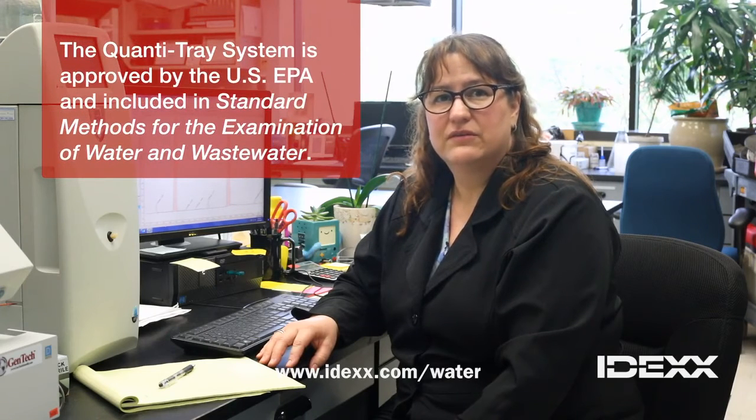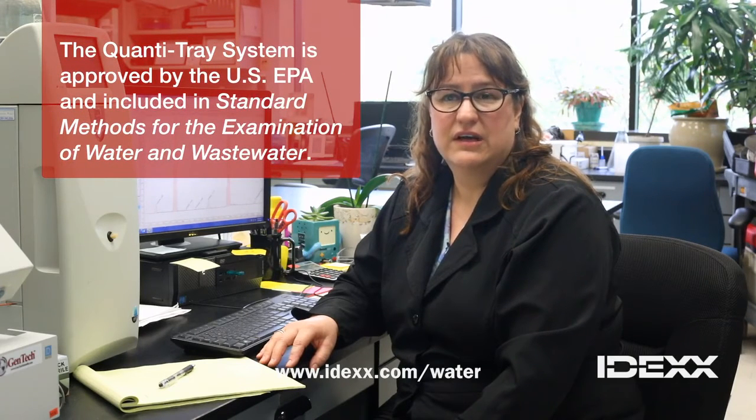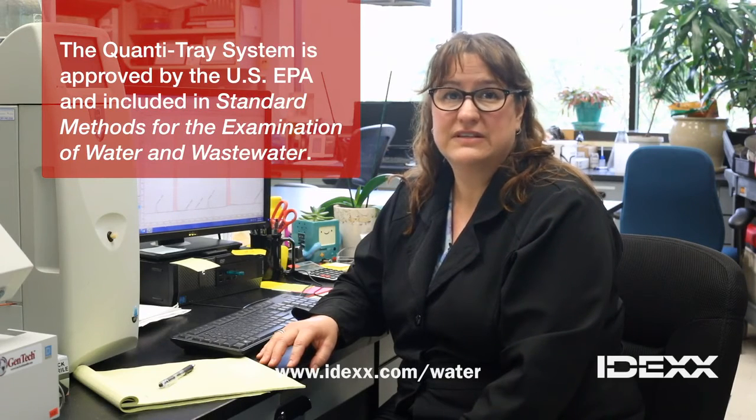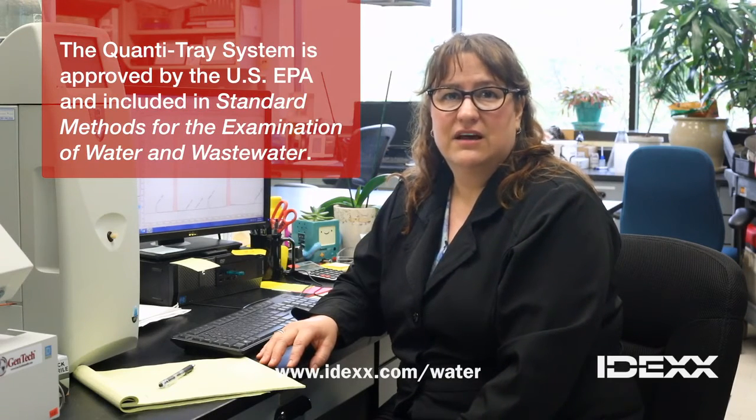Analytical laboratories have quite a few challenges coming up, especially for both drinking water and wastewater. We have per and polyfluorinated compounds, PFAS, regulations that are just around the corner. The EPA is going to start issuing those environmental laws, and laboratories are going to have to meet those regulations. So the technology has to get more and more advanced for the testing, and the people need to be more and more trained.